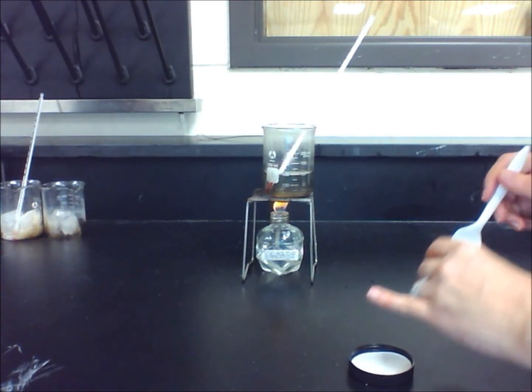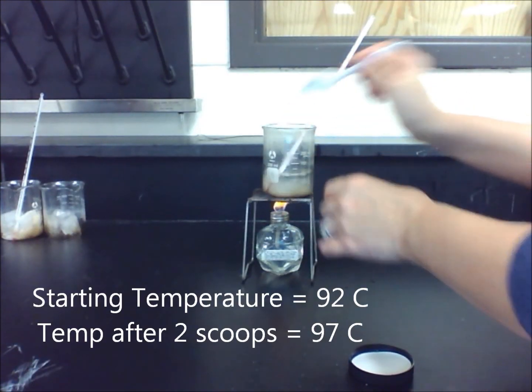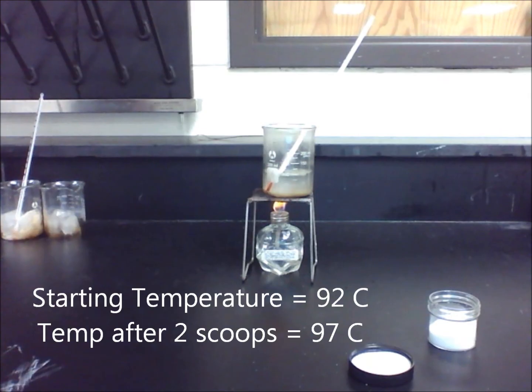Wait at least one minute before observing what happens. Record the temperature. You will notice that the temperature increased by a few degrees.